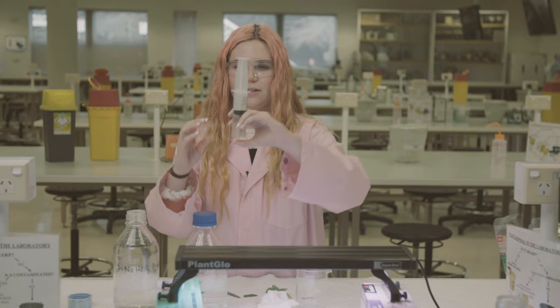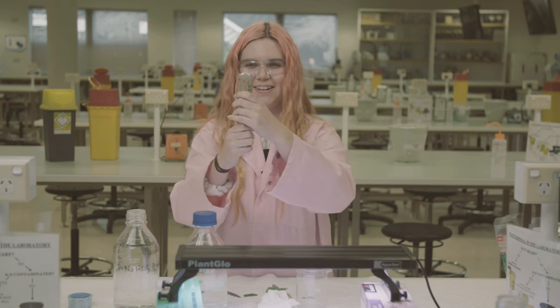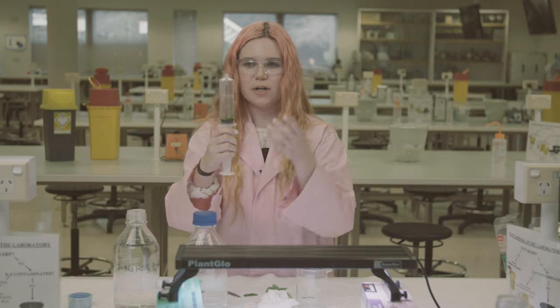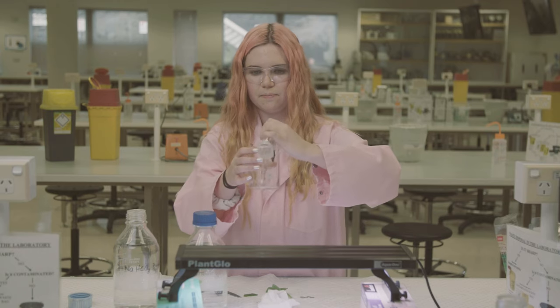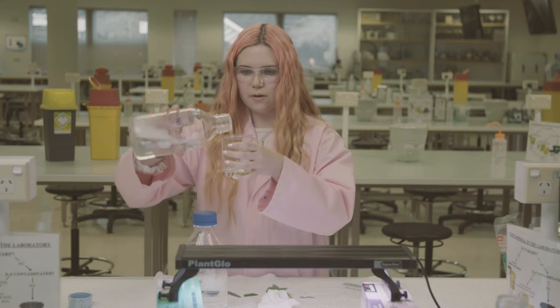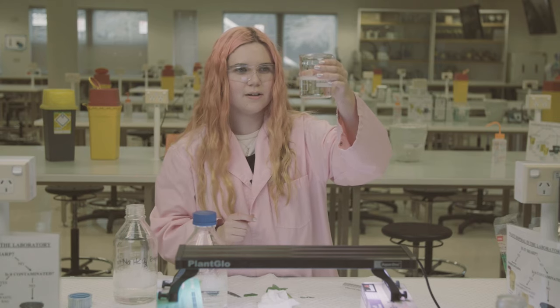You block the end to tip it upside down, then pull the plunger all the way down so it's easier to pull the bottom of the syringe out. Tip it upside down again, pull out the syringe, and tip it into our beaker. You can then top it up a bit to make it easier to see if they float, and just double check that they all do sink. Pull out any of the ones that are still floating.